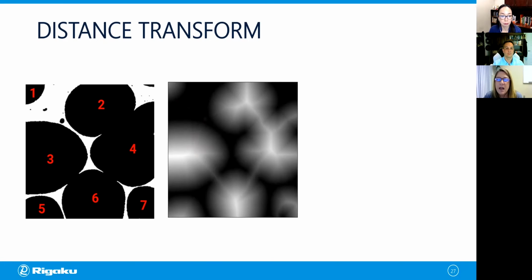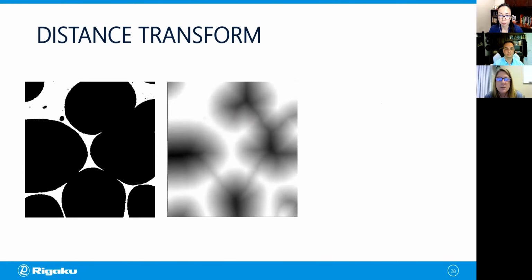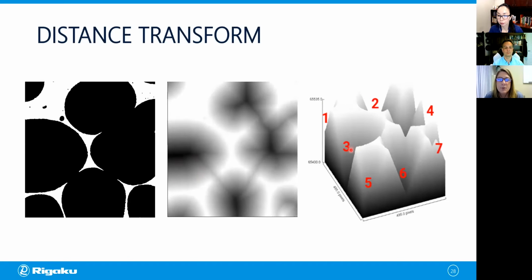If we plot the 3D intensity of this distance transform image, we get the following. In this plot, you have your 1, 2, 3, 4, 5, 6, 7. And it turns out that each of our objects corresponds to a peak in this surface plot. So it's the exact opposite of what we want. We need to correct this, and that's easy to do. We just invert it. So we've inverted the values, and now if we calculate the surface here, we see 1, 2, 3, 4, 5, 6, 7, and here is 6, for example, and it corresponds to a basin, which is exactly what we need in order to do the watershed transformation.